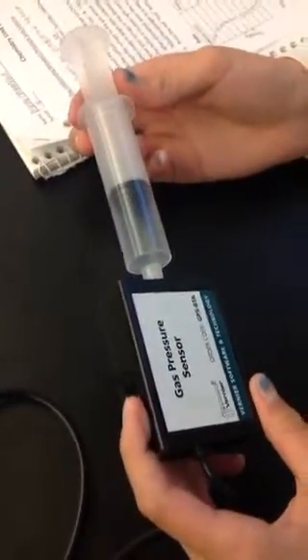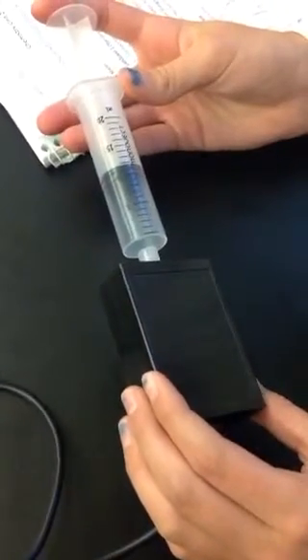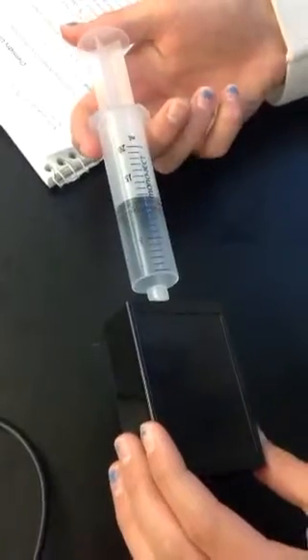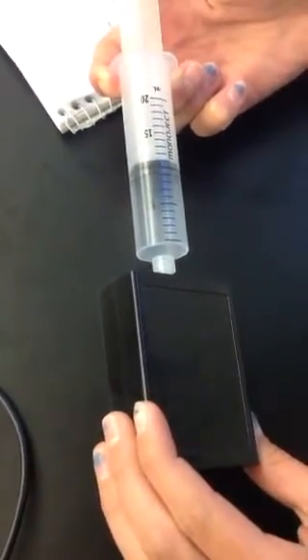All right, so for each data point, we're going to set the syringe to a certain volume, and then we will hold that data point and keep that data point on our screen. So here's our first volume, and we're going to save that. And we're going to come over and do that again with a different volume. So we've got 9 milliliters. We're going to save that.